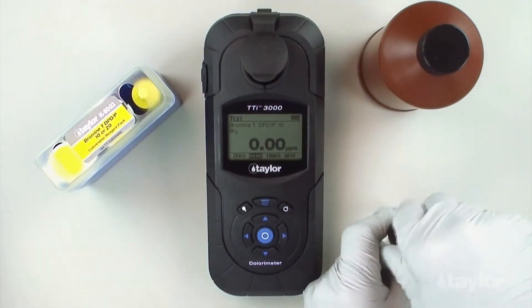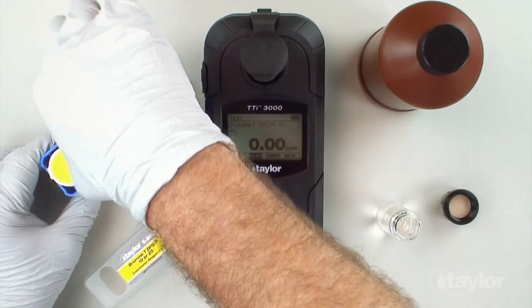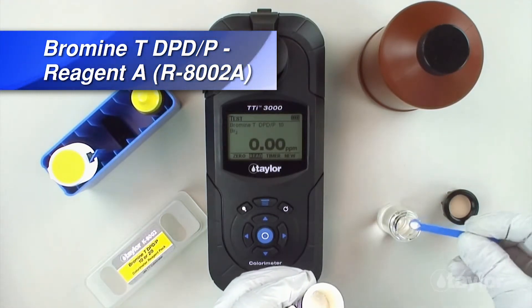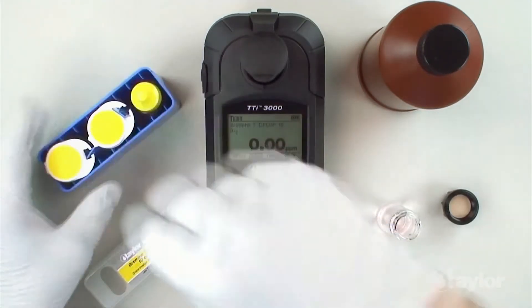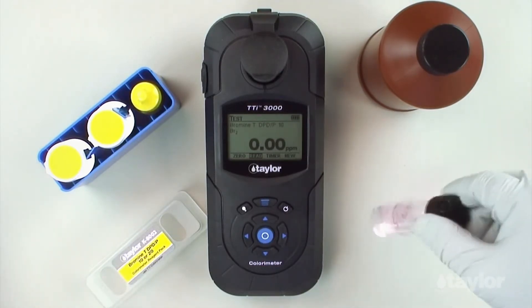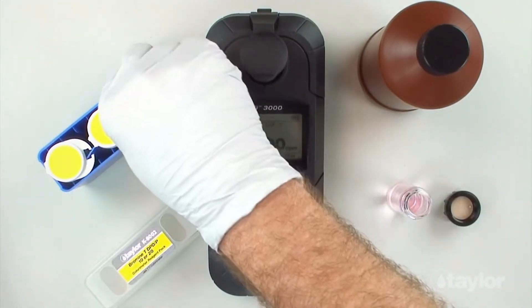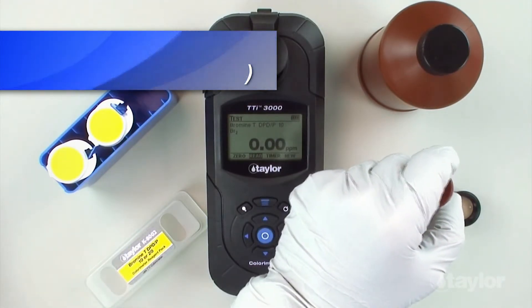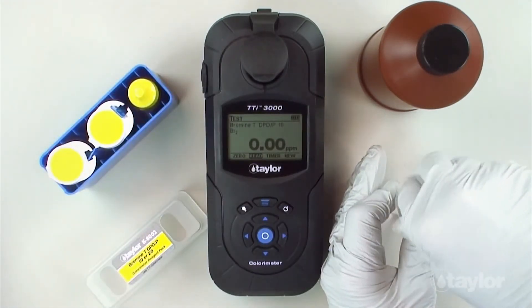Remove the sample cell from the sample cell compartment and remove the cap. Using the 0.15 dipper spoon, add one level dipper bromine total DPD-P reagent A. Swirl to dissolve the powder. Add five drops bromine total DPD-P reagent B. Cap and swirl to mix thoroughly.